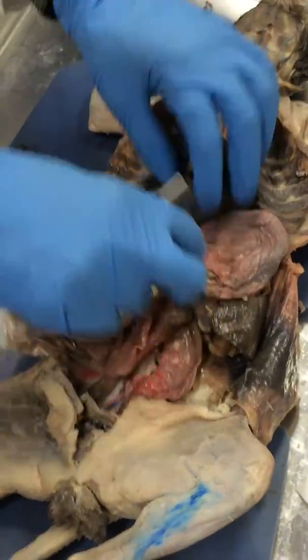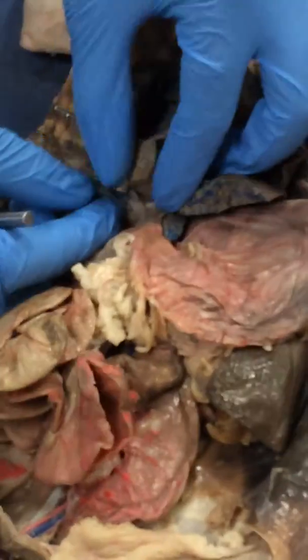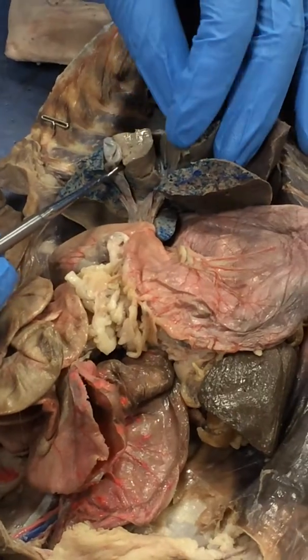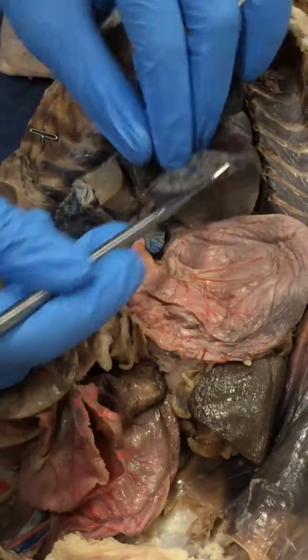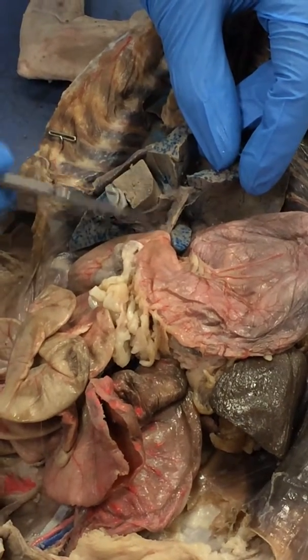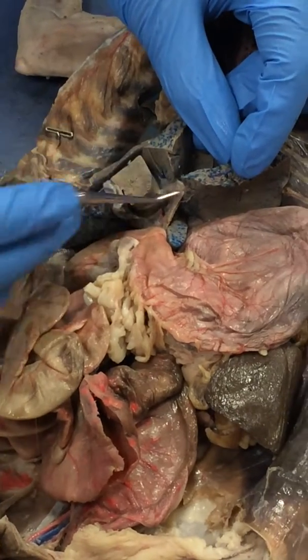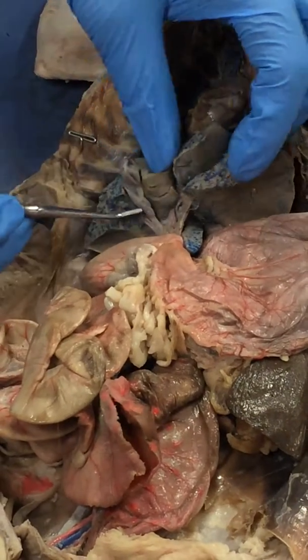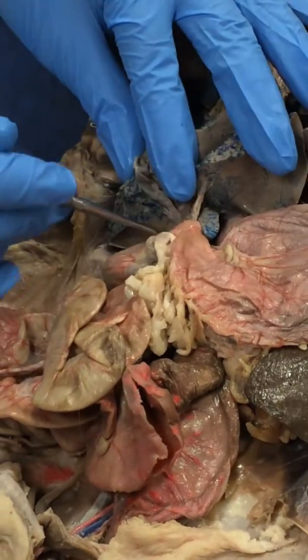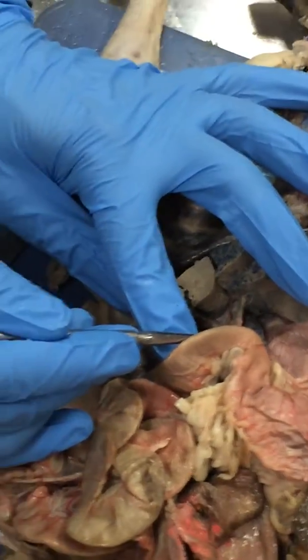That's that. Now coming back to the liver, there's the liver obviously, and you have the gallbladder. The liver produces the bile and stores it in the gallbladder. How will you identify a hepatic duct? It's coming from the liver. If it's originating in the liver, it's a hepatic duct. If it's originating from the gallbladder, it has to be the cystic duct. And if it's connecting to the duodenum, it has to be the bile duct.